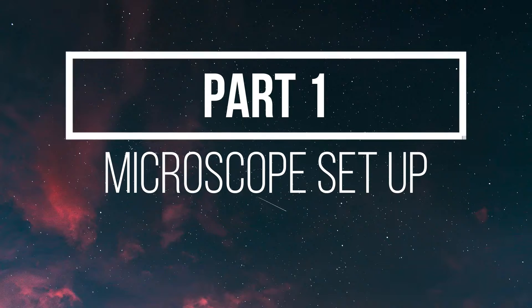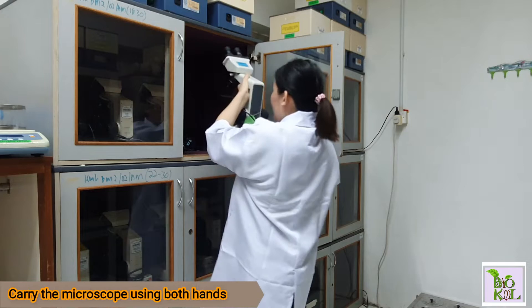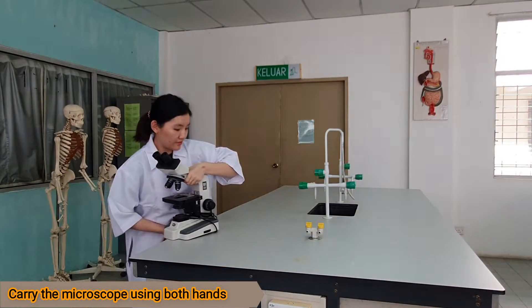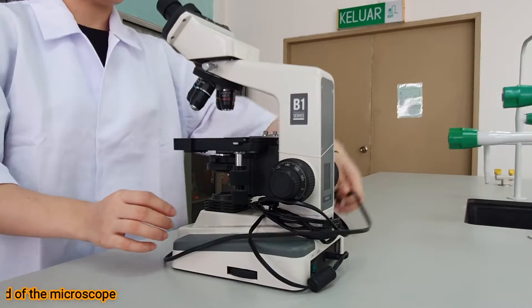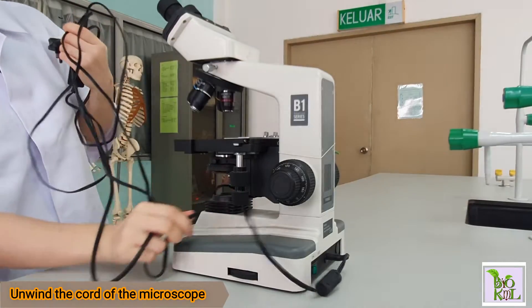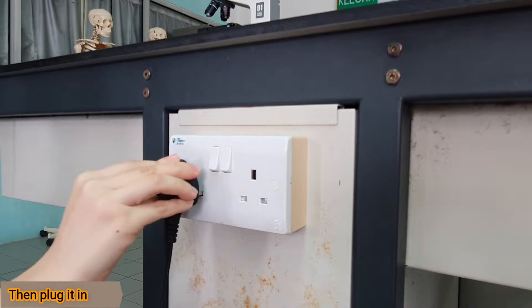Part 1: Microscope Setup. Retrieve a microscope from the cabinet. Carry the microscope using both hands. Unwind the cord of the microscope. Make sure that the cord is secured, then plug it in.